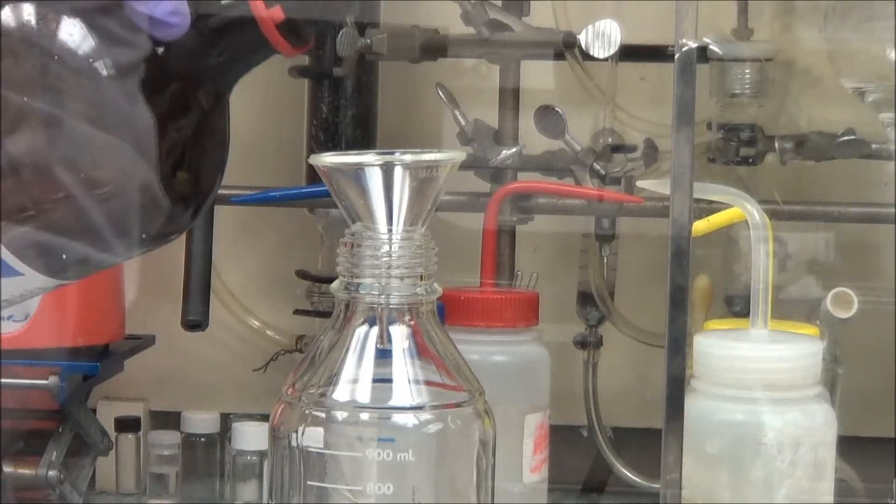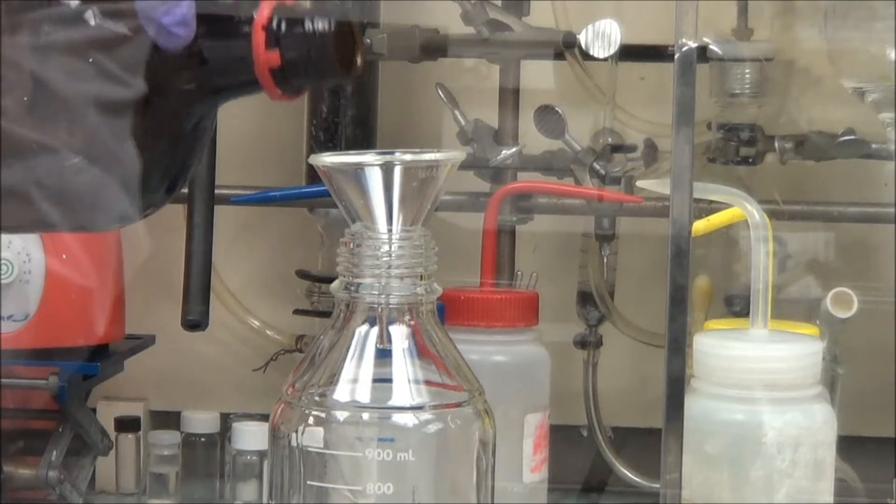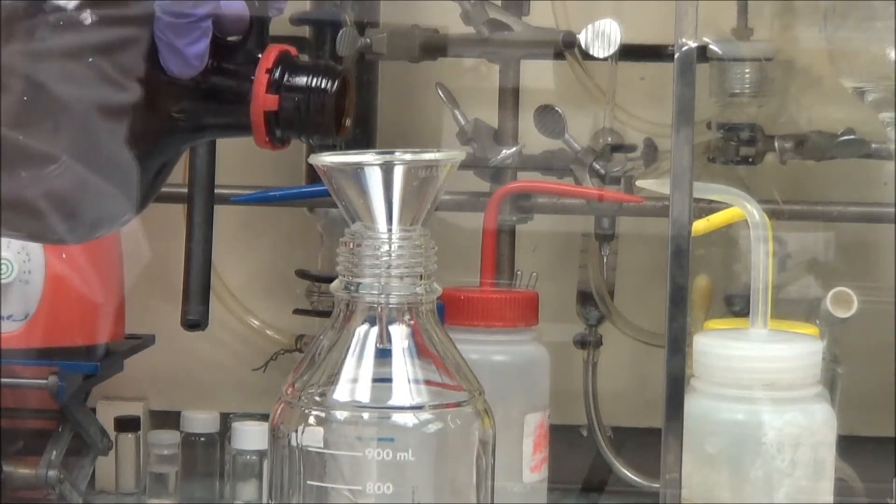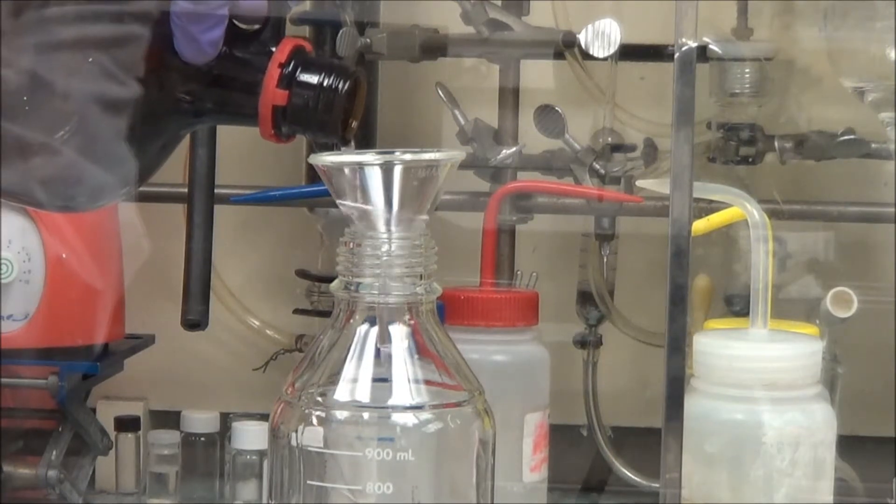As in all things, we're going to practice good chemical safety. You see we have the appropriate protective gear. We're going to use a funnel for transferring a solution.